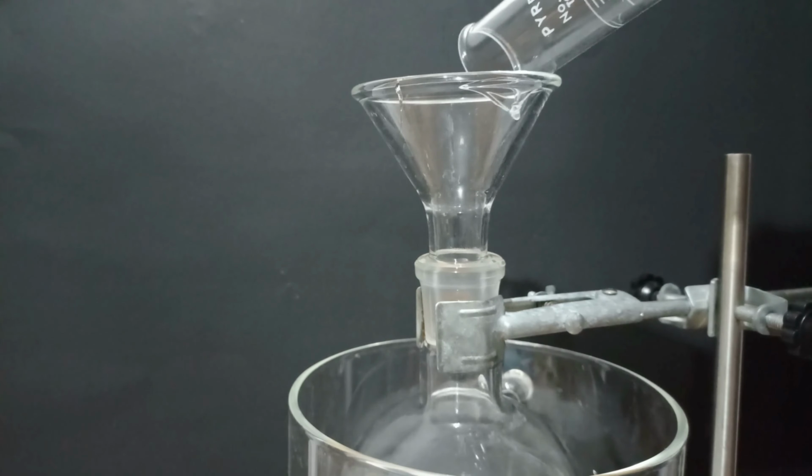I added 100 milliliters of hydrochloric acid at 28%, which represents a very high excess, more than 3 times. As you can see, paracetamol is quite insoluble in water. For starting up the reaction, we are going to microwave the mixture in a total of 12 sets of 10 seconds each. Then I set up the reflux apparatus with a sodium hydroxide trap for acidic fumes, as you can see.